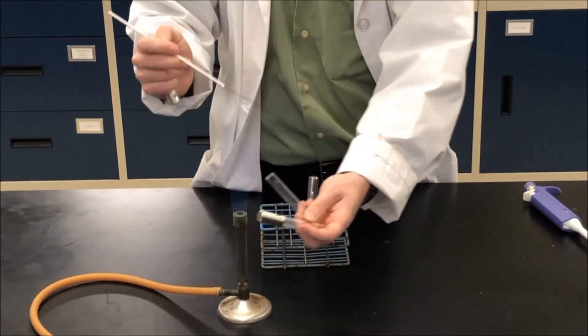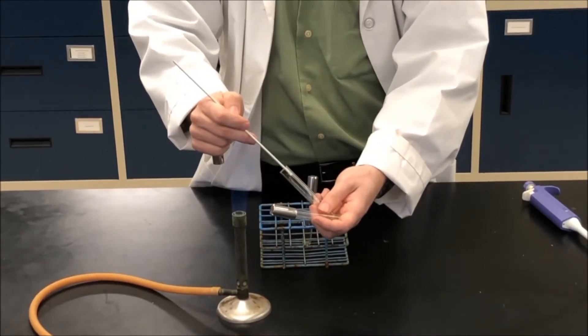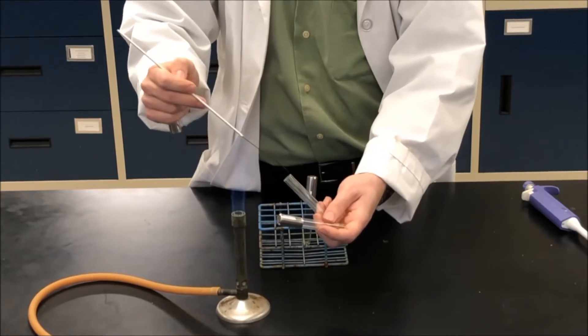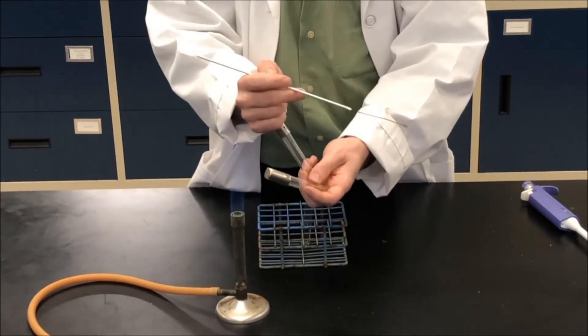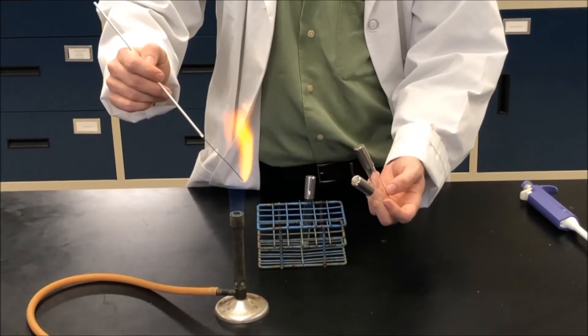New test tube, flame, mix, flame, close, and flame again.